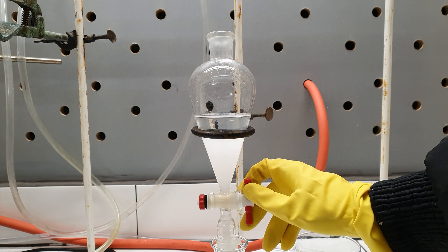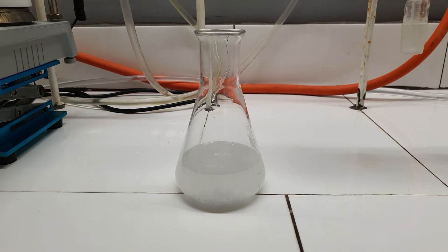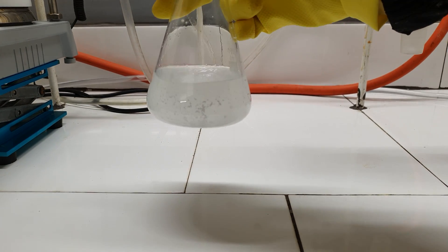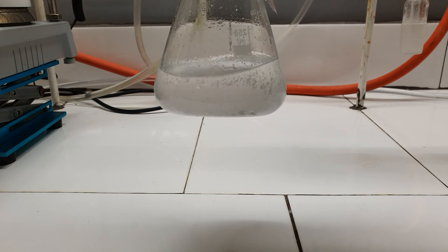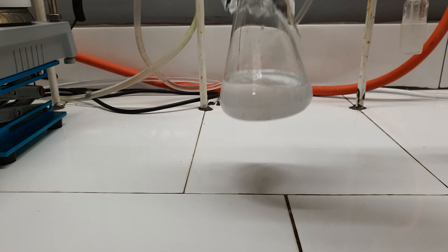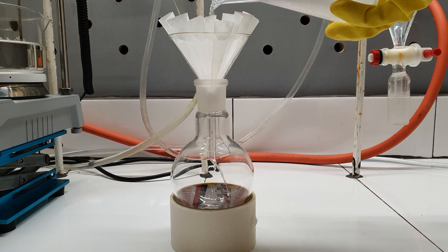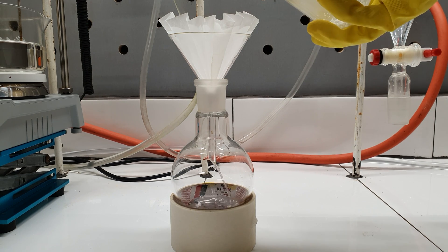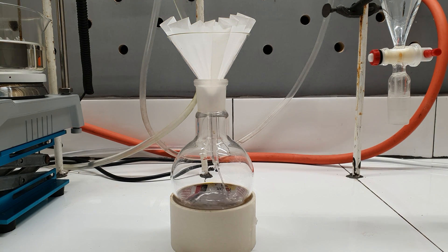Unfortunately the sodium chloride wash didn't work as well as I expected, so I continued drying by adding some anhydrous sodium sulfate. The salt helped a bit but the solution was still cloudy. It turned out the cloudiness was caused not by emulsion but by suspension — probably some of the sodium bicarbonate had precipitated during the washing steps. When I filtered it through filter paper it all came perfectly clear.